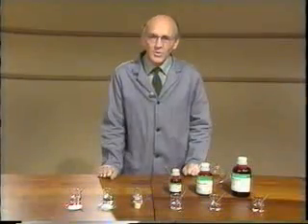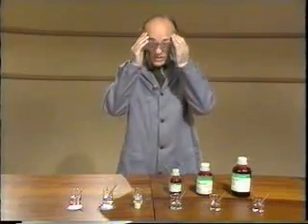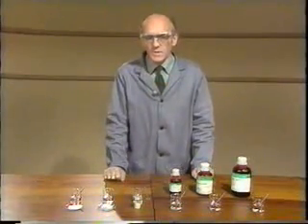You can use these results to classify the elements into metals, non-metals and semi-metals or amphoteric elements. Don't take too much notice of small differences in pH because I didn't control the concentration of the solutions. Now you should plot a graph of pH against the chloride and use it to predict the pH of a solution of chlorine. Now I'll perform a similar series of experiments using hexane instead of water. That should give you some idea of the bonding in the substances.